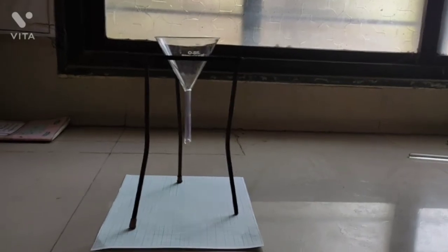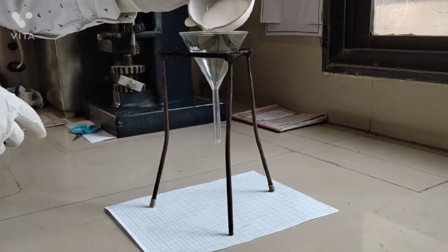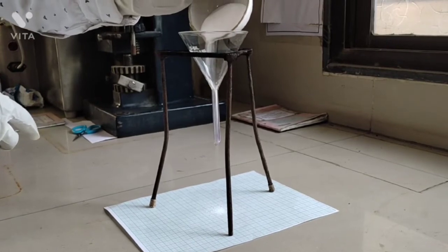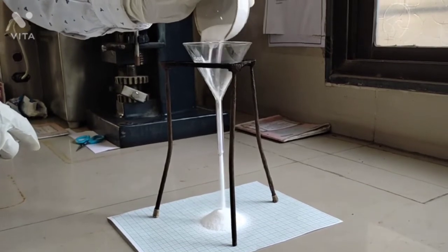Now let's find out the angle of repose of our formulation. Prepare a setup as shown in the video. Then pour prepared powder in a funnel. Then draw the outline of the cone which is formed by the powder.